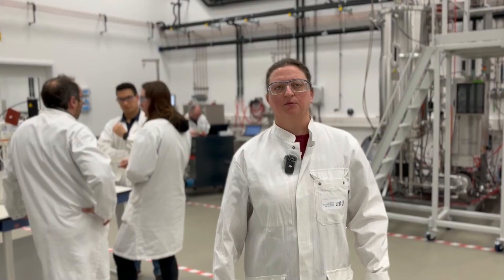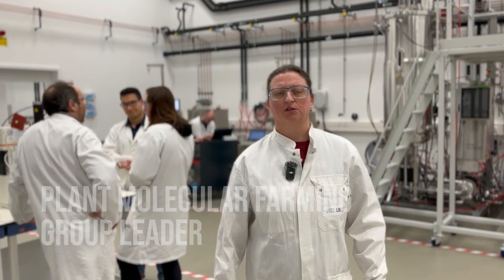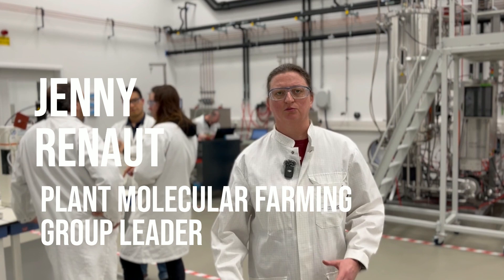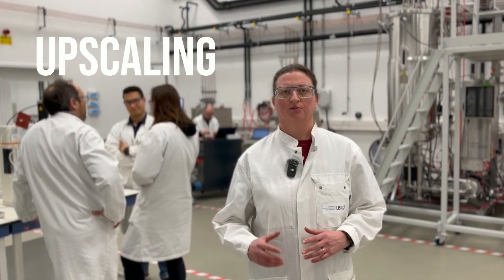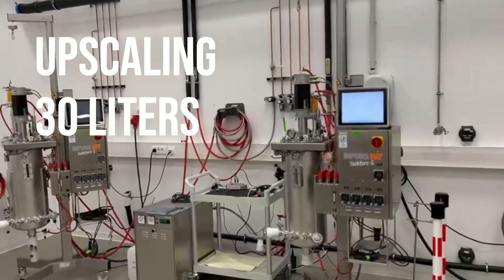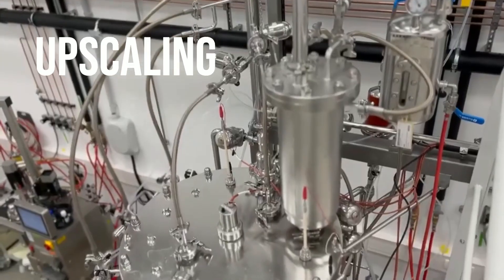After the optimization of the parameters for the culture of the plant cell suspensions, we go into this room to make the upscaling. From 4 liters, we will then go to 30 liters, and the 30 liters will be used to seed the 300 liters.